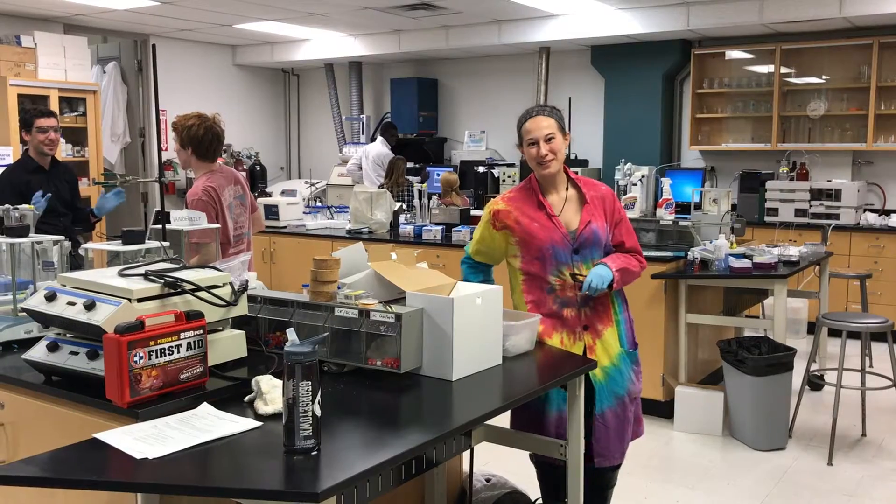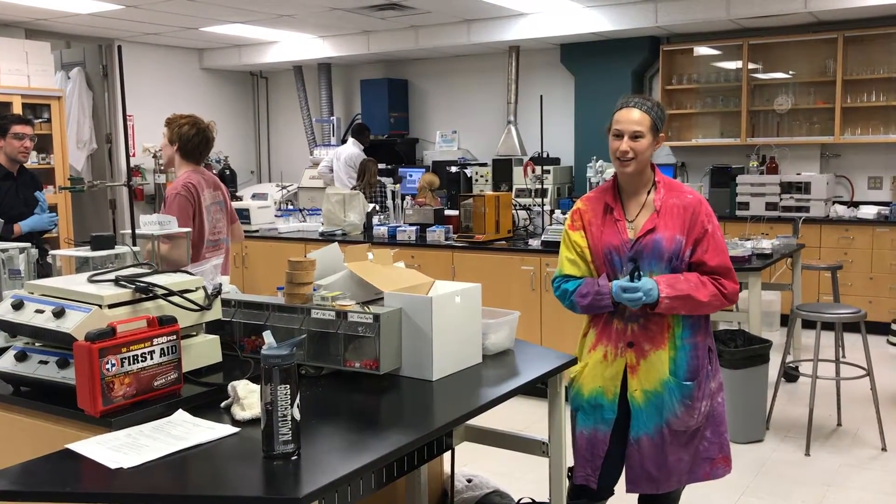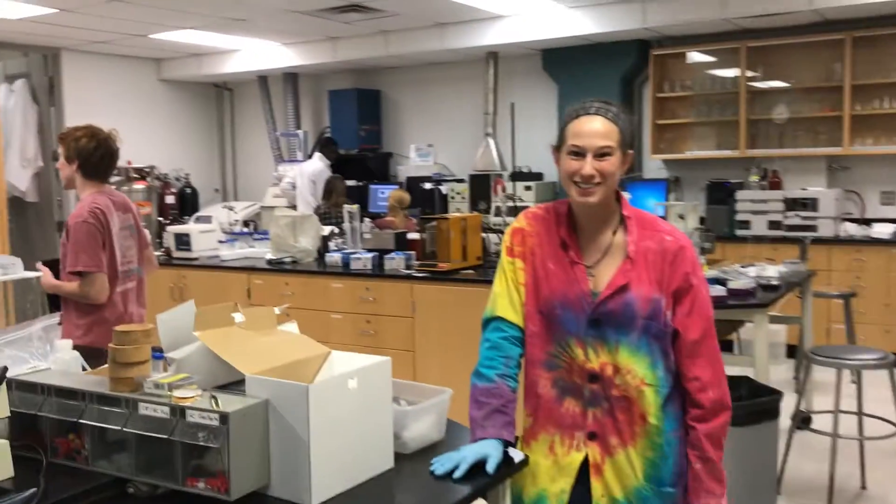Thank you for visiting my lab today. I'm glad I got to show you how to use the Flame Atomic Absorption Spectroscopy, a.k.a. the FAAS. I hope to see you again. Maybe you'll be in my class next semester.